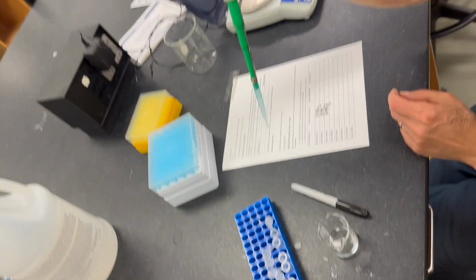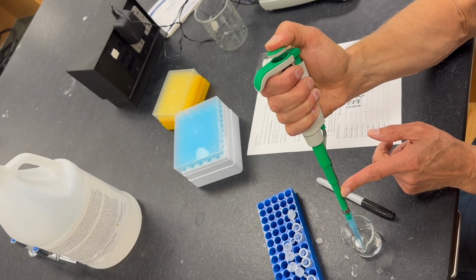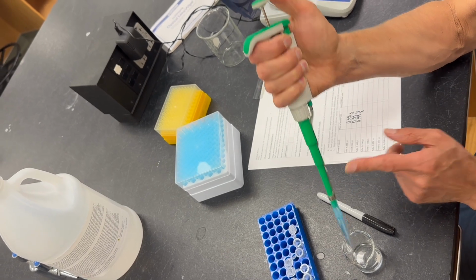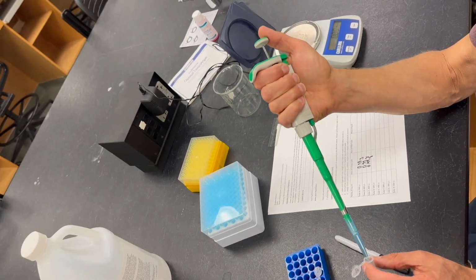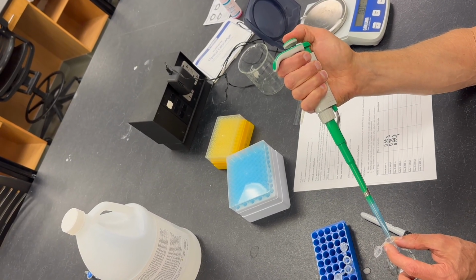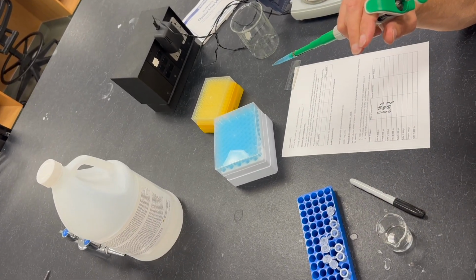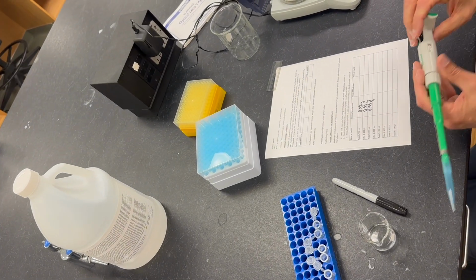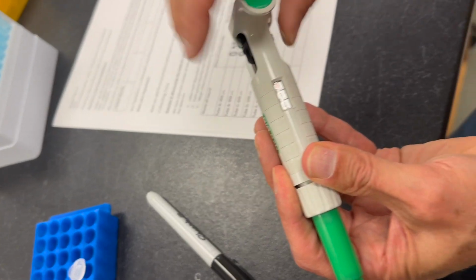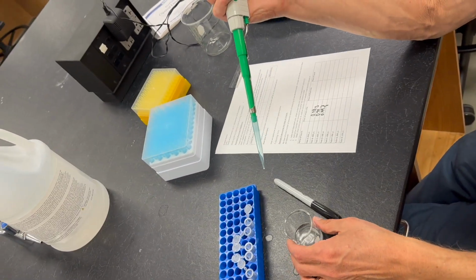We're going to now press the plunger down to the measuring position. Then going to dip the pipette tip barely underneath the surface of the liquid, and we're going to slowly measure the liquid, and then we will allow the liquid to run down the Eppendorf tube, and then we'll close it up. And I am going to change the volume to 800 microliters, which is the next volume that we need to measure. And we'll do the same thing.